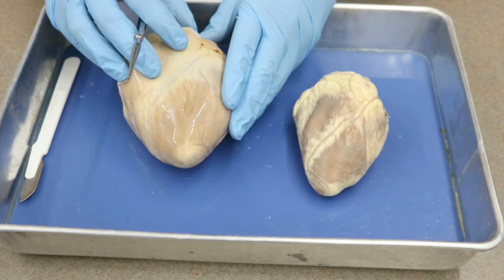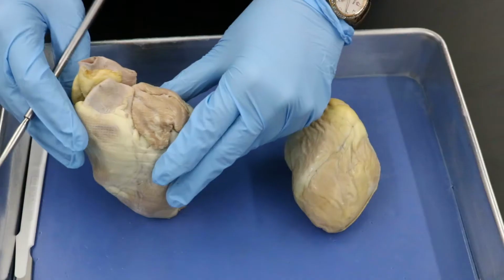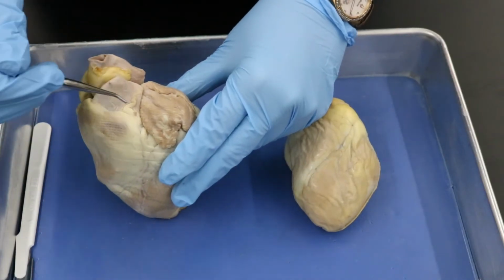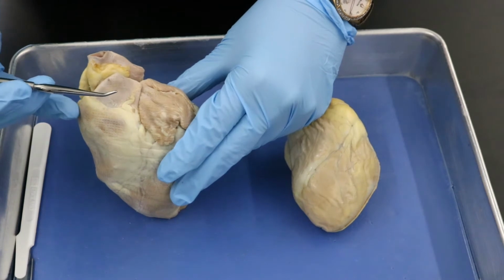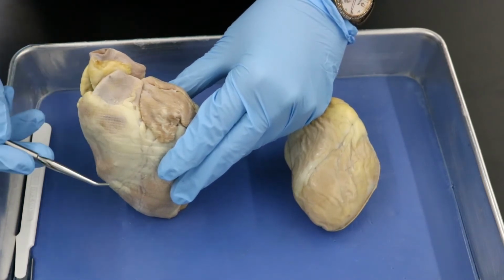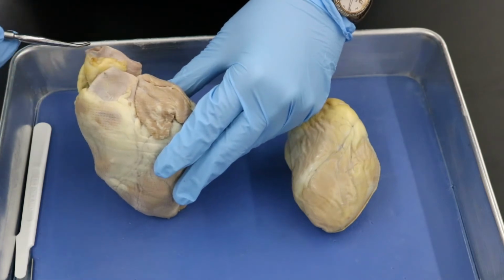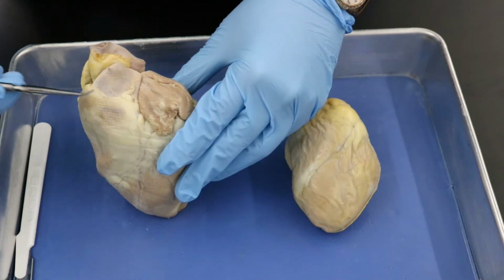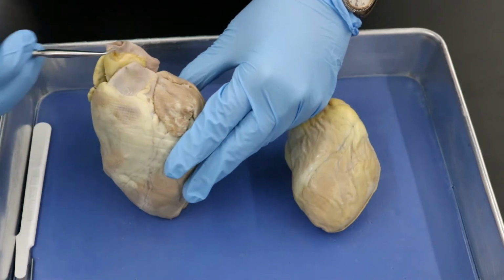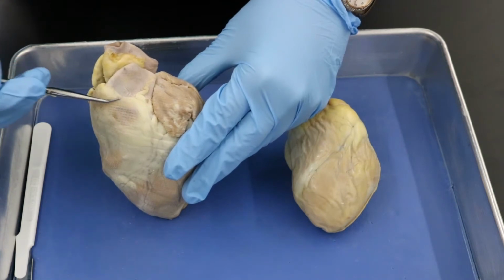So let's see, what do we want to do next? Let's look at the great vessels. The great vessels here are structures that are coming out or into the heart. To be able to tell which one's which, you really have to have already oriented yourself, because they cut them so short, it's difficult to identify them otherwise. So in a testing situation, I would always orient myself first, make sure I know what I'm looking at before I try to identify the different vessels, okay?